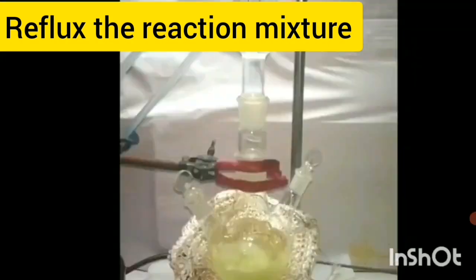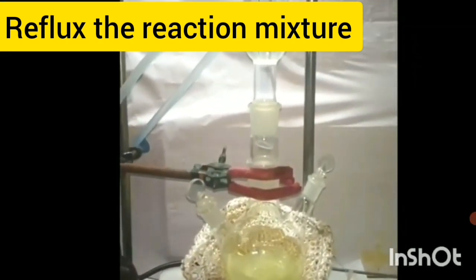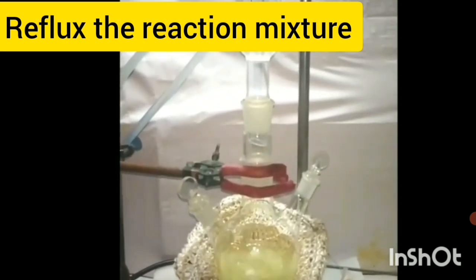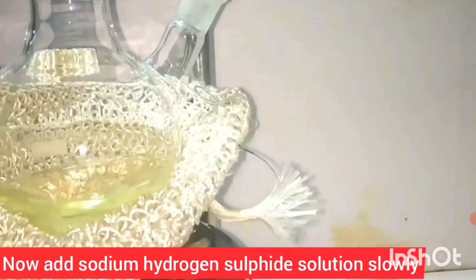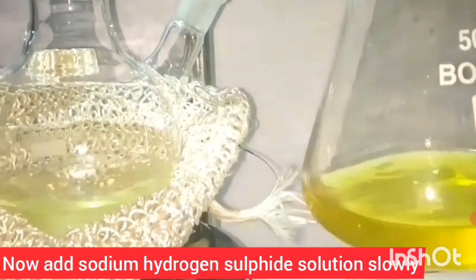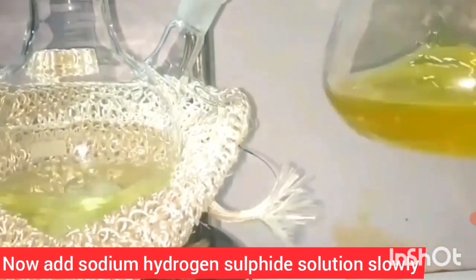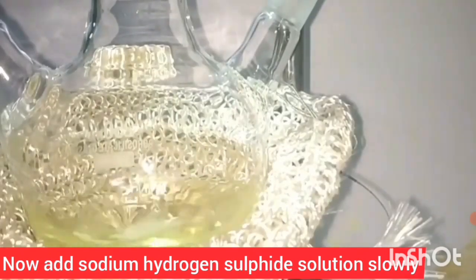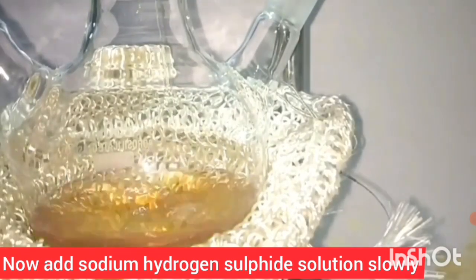To the solution of M-dinitrobenzene, heat it up to the reflux temperature. Then slowly add the reducing agent NaSH — sodium hydrogen sulphide solution — drop by drop.